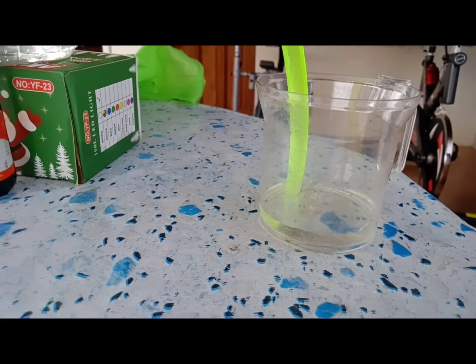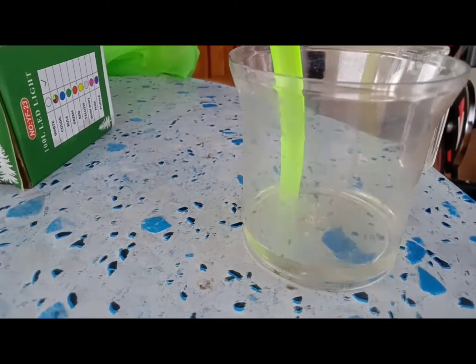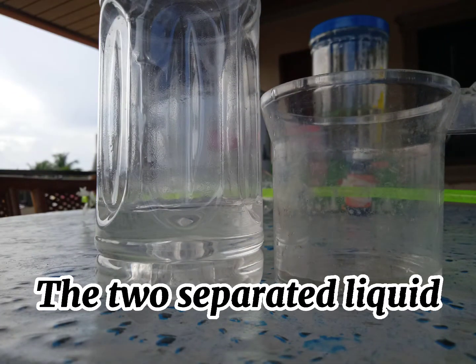After the process, the two components are now completely separated. The acetone fills the container and the water was left inside the bottle. So here with me are the two separated liquids, the acetone and the water.